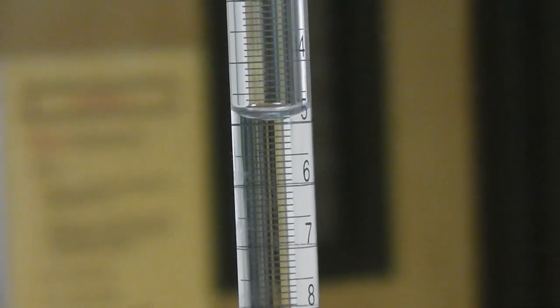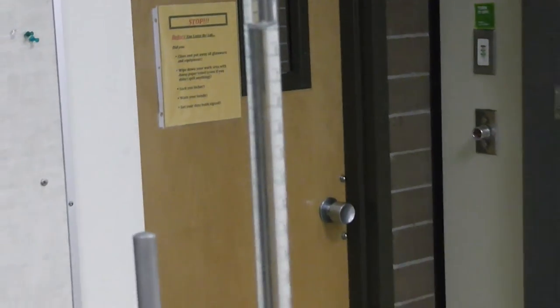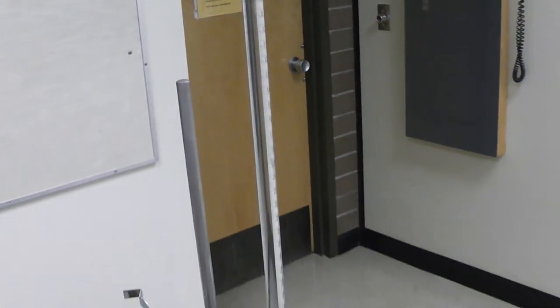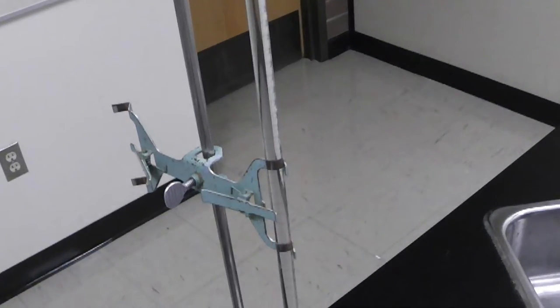This demonstrates a proper setup for your titration. You have your burette, filled with your solution, attached firmly to the ring stand with the clamp as shown here. Make sure your clamp is secured tightly.